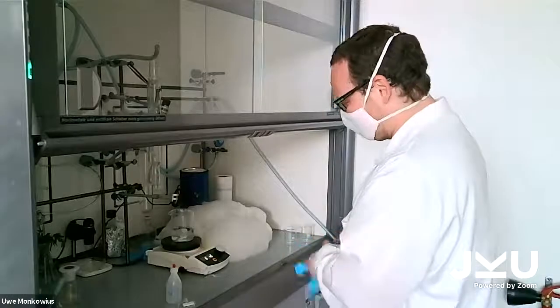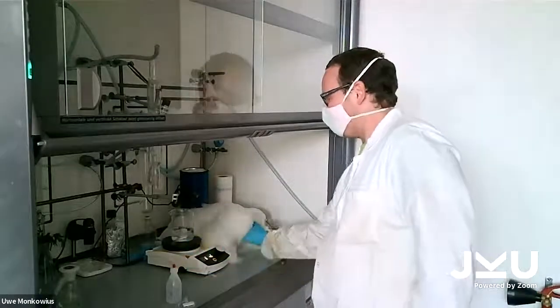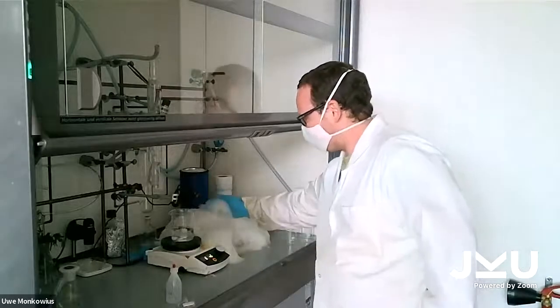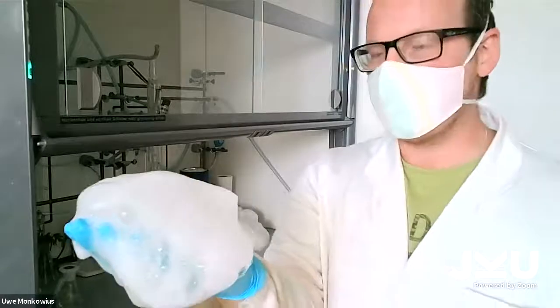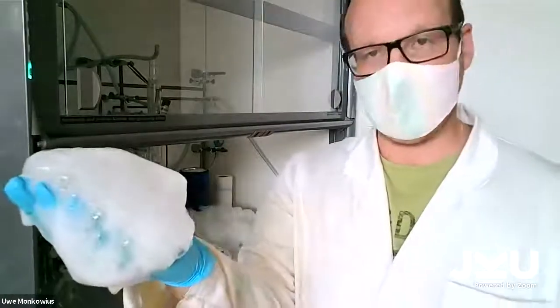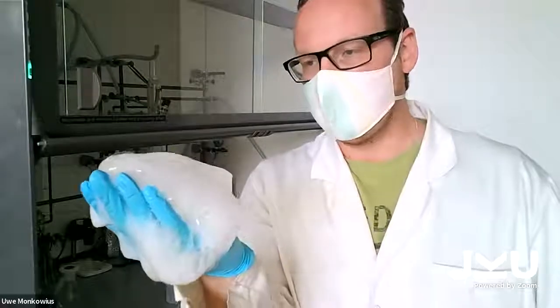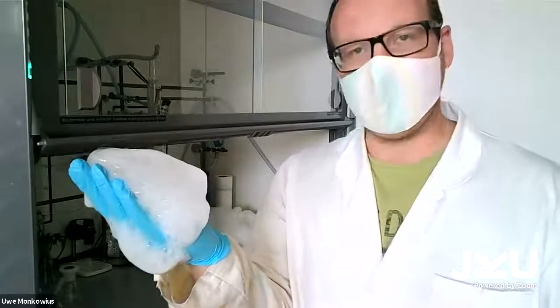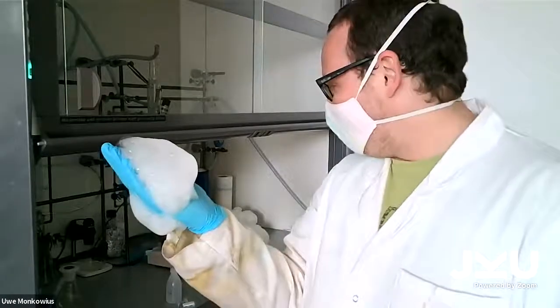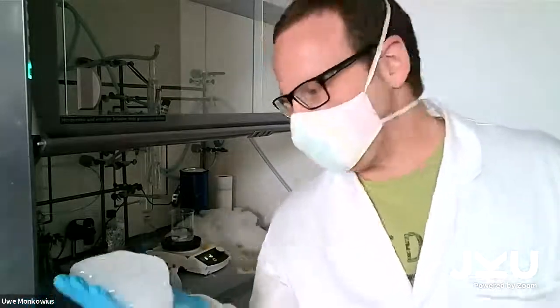I should not try to touch it with my hands, but you can see. Oops! Oh, it's hot. You can see foam. The foam is pretty stable. I added some glycerin to the soap so that the foam gets stabler. Yeah, and while I clean up this mess, my colleague may be able to continue with the oscillating reaction.